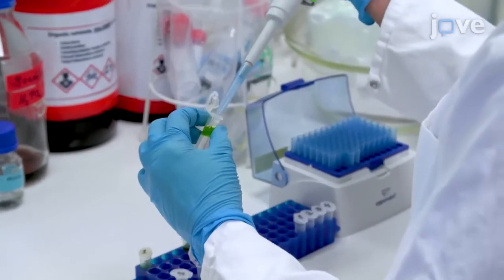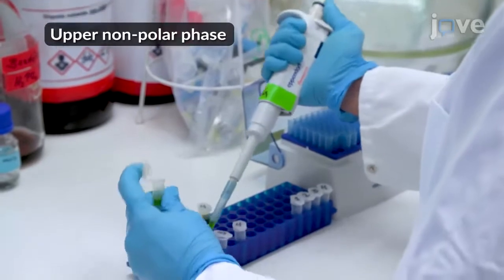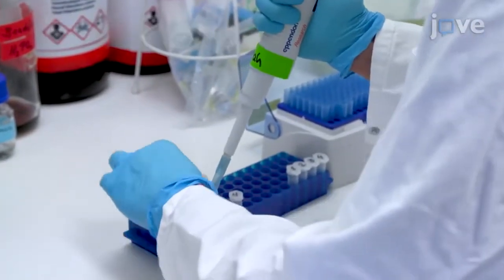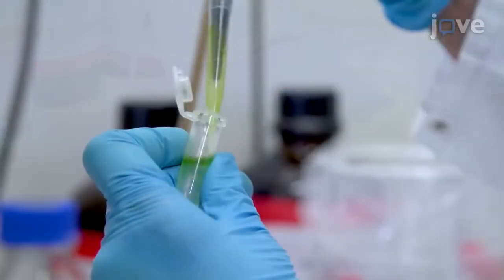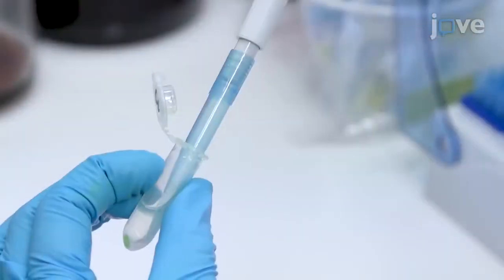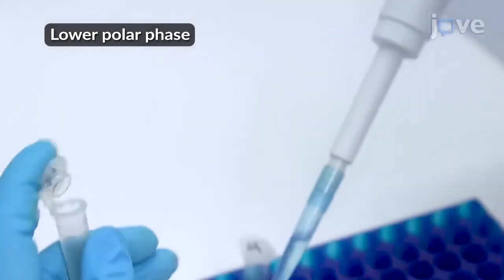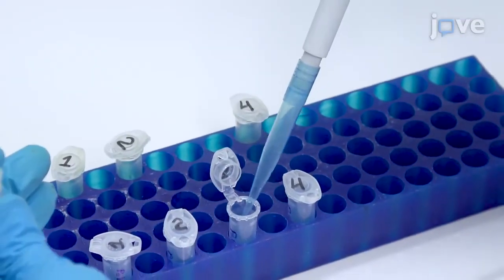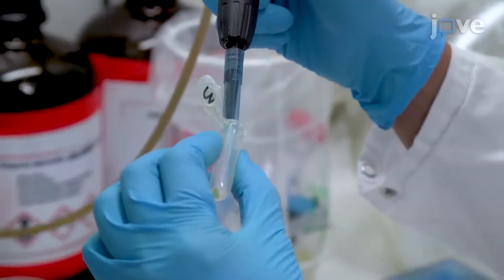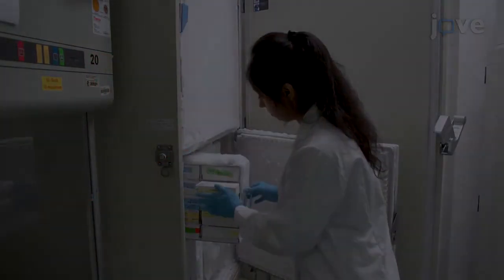To aliquot the fractions, transfer 500 microliters of the upper MTBE lipid phase into a labeled 1.5 milliliter tube. Use a 200 microliter pipette to remove the lipid phase, and transfer 650 microliters of the lower polar and semipolar metabolite phase into new labeled tubes. Aspirate the excess volume to remove the remaining lower phase, and freeze the solid pellets in liquid nitrogen.